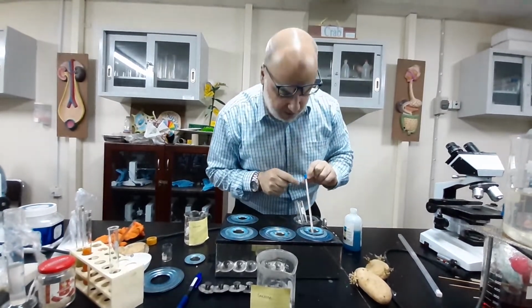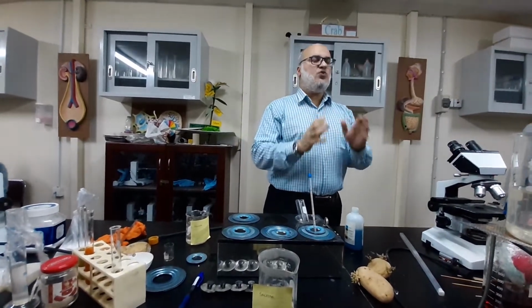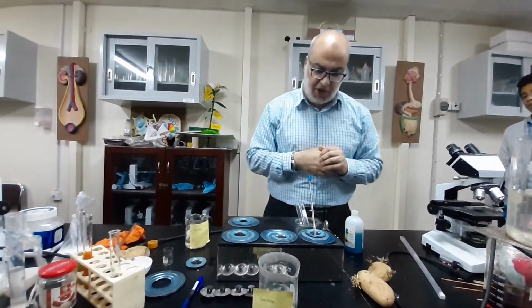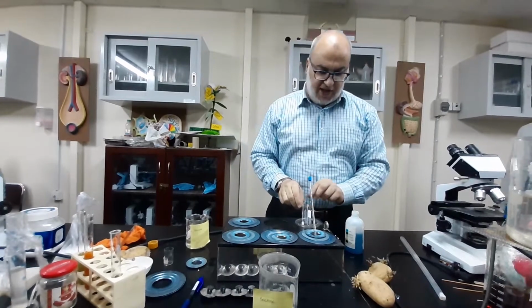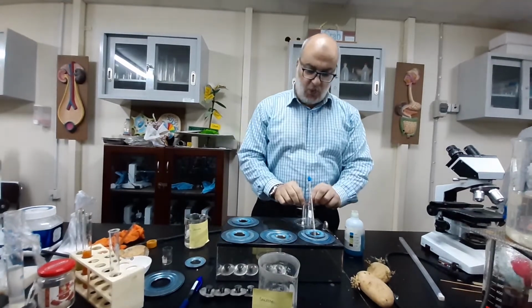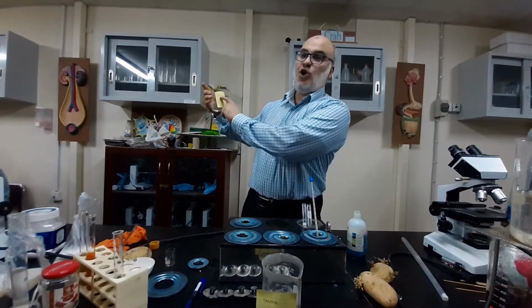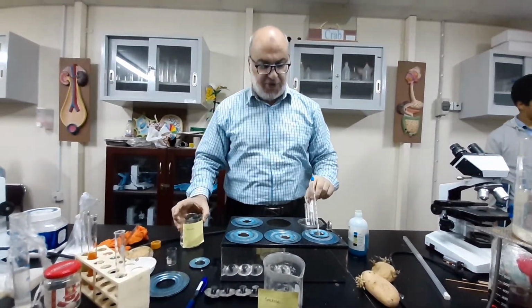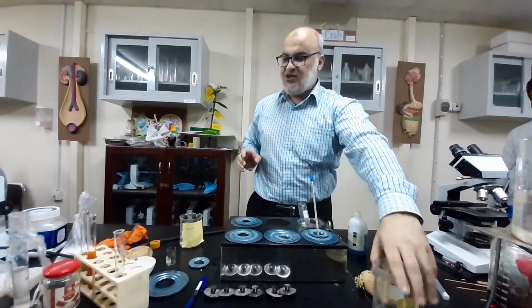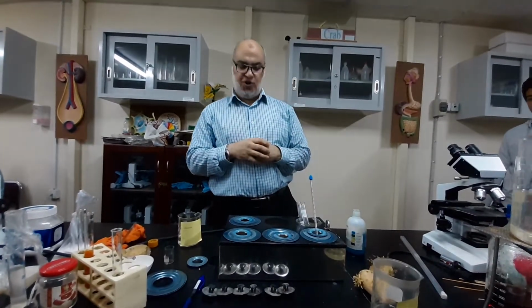Don't forget the temperature should be above 90. It's from 80 and above. 80 would be working, 90 would be working, or even higher than this would be working. Now, this water bath is containing the two tubes. Don't forget, the one number 12 is containing glucose. And the one number 13 is containing sucrose. Which of them is gonna change first or faster? The one containing more reducing sugars.